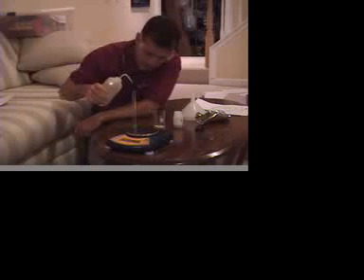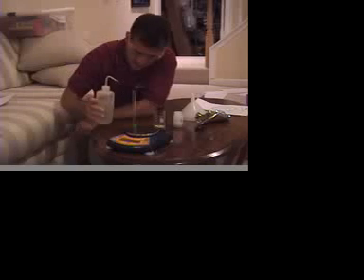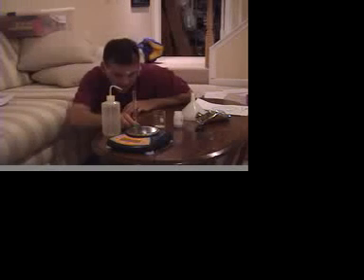So I guess what we'll do here is we'll put somewhere between 4 and 6 milliliters of water in here. And wherever it is, it really doesn't matter. It's anywhere between 4 and 6. But you do have to take a measurement of it. So anywhere between 4 and 6 milliliters, I guess, is pretty good. If it doesn't work, we'll try it again.